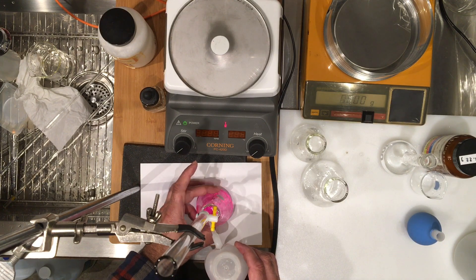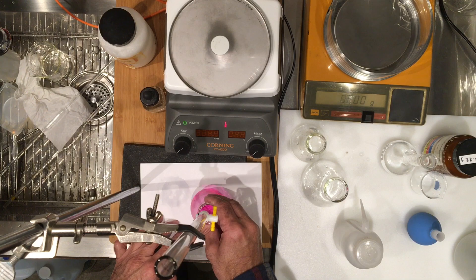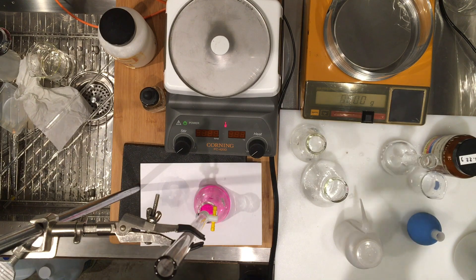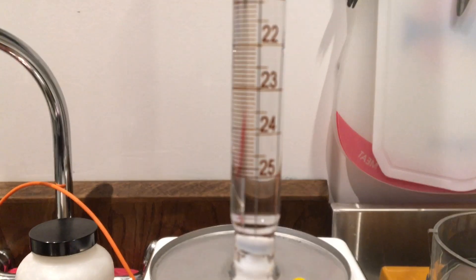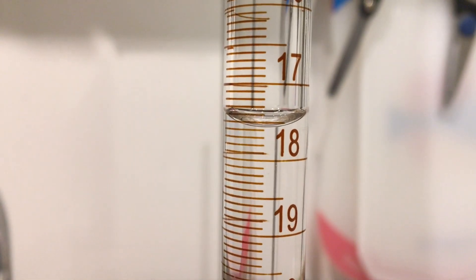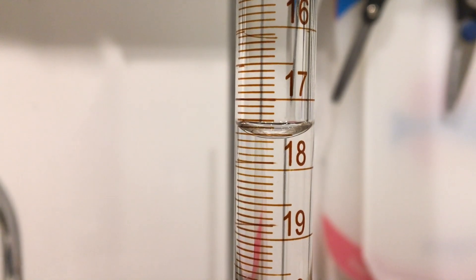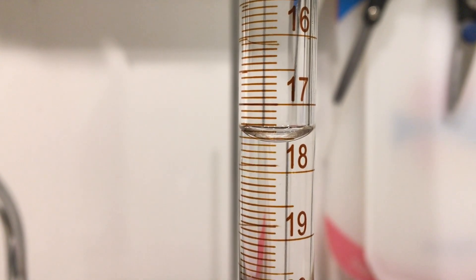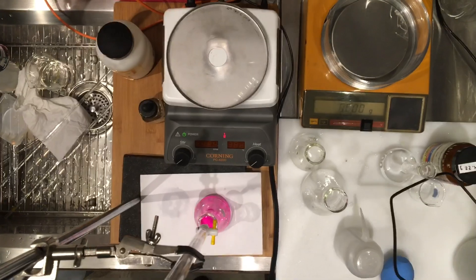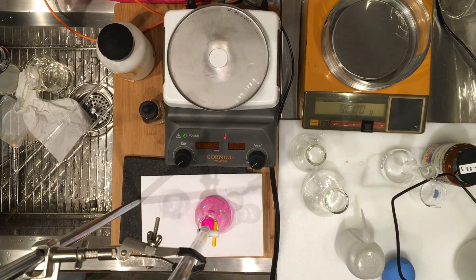Record the volume — I'll wash the sides. I may have gone a little over but we'll average these values anyway. Let's go ahead and have you record this volume. This is for titration number one and I'm going to record this volume myself.